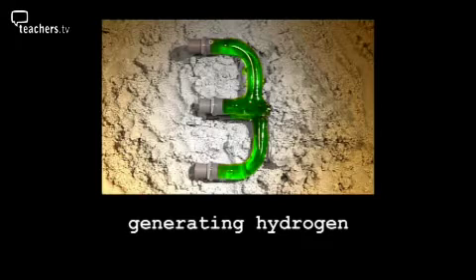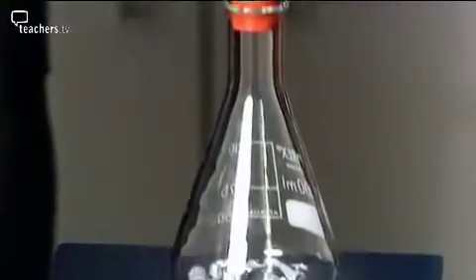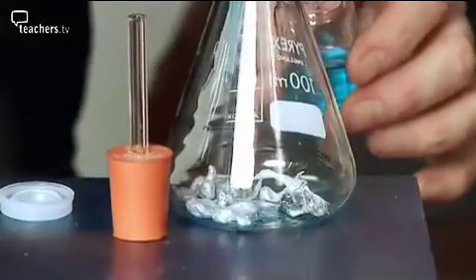Number 3, the explosive nature of hydrogen. We get quite a few hydrogen explosions reported to us, and this was an experiment that was reported to us by a school. All it is is the usual way of generating hydrogen, so we've got some zinc metal in the bottom, and we're going to react it with some 1 molar sulfuric acid. Copper sulfate solution will act as the catalyst.